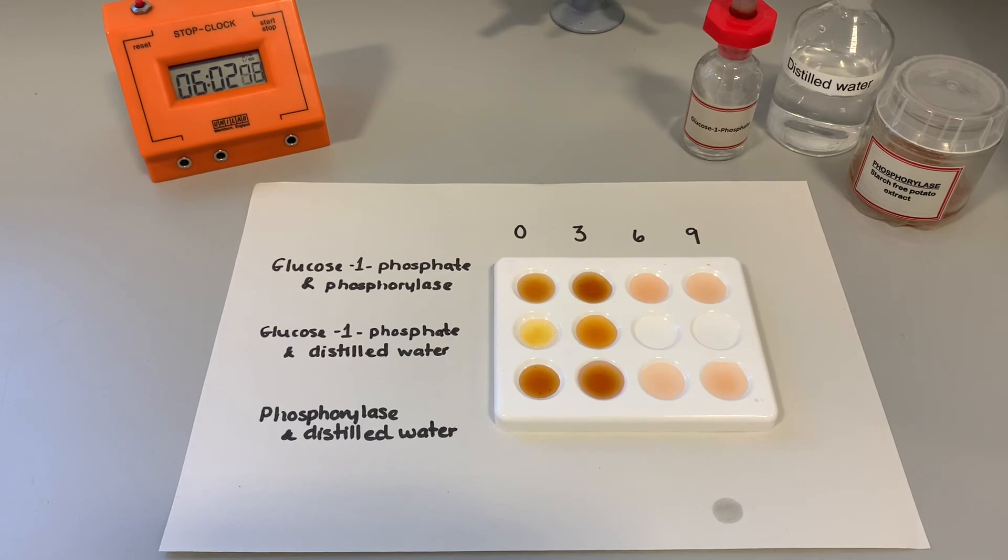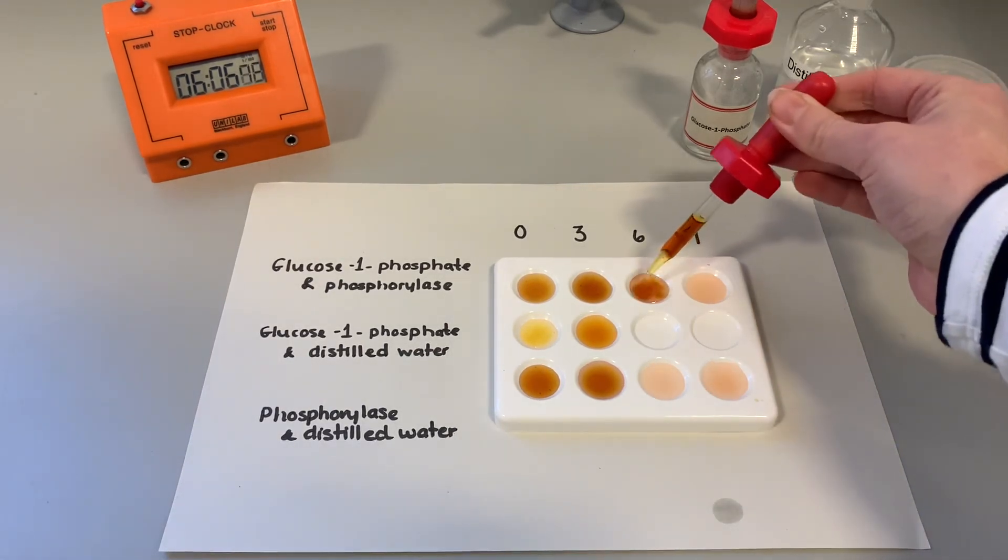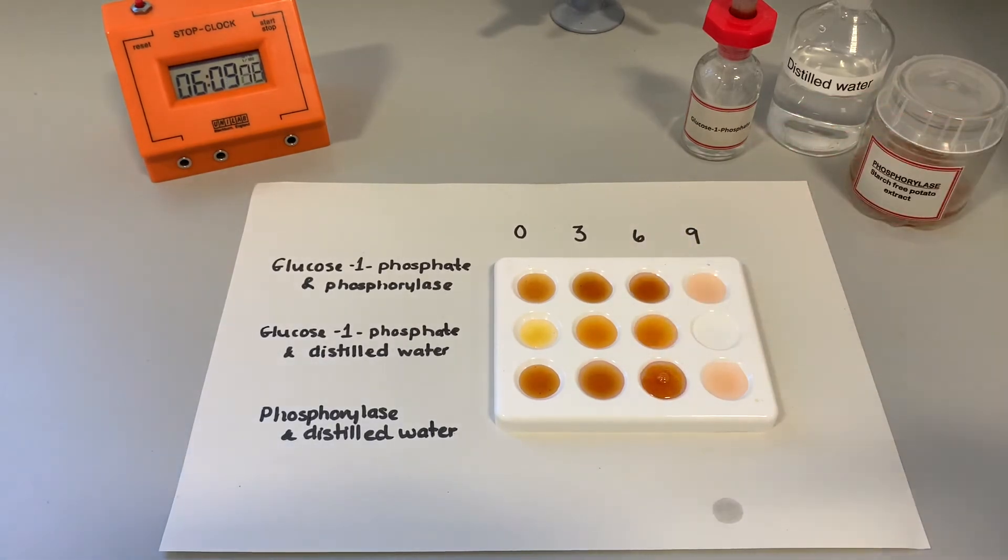Let's have a look at six minutes and see if any starch has formed. Not at present. So another three minutes and then we'll do the last one and find out if any starch is present.